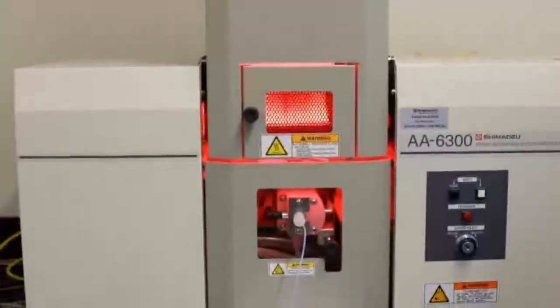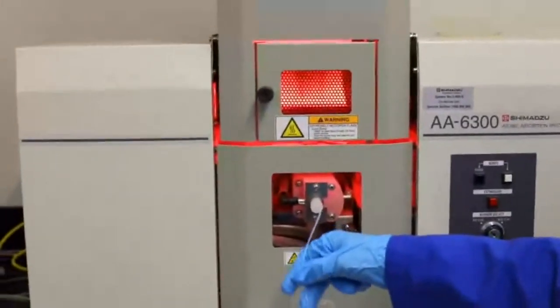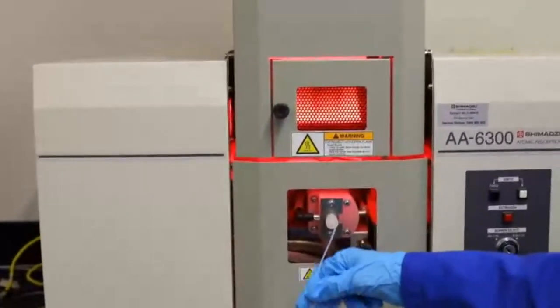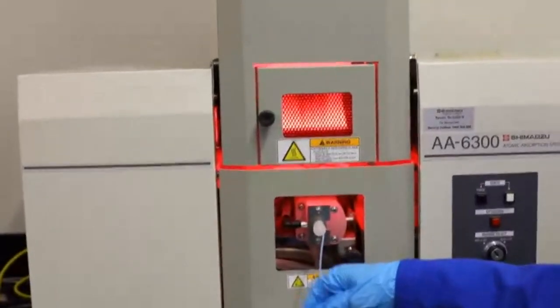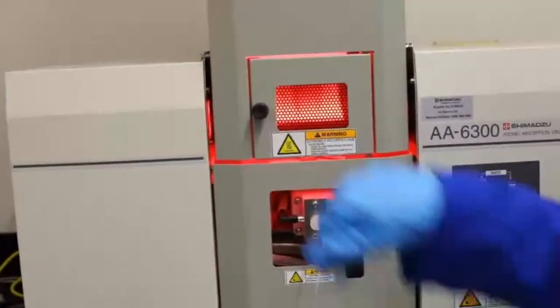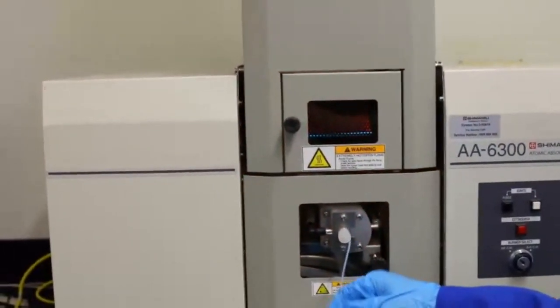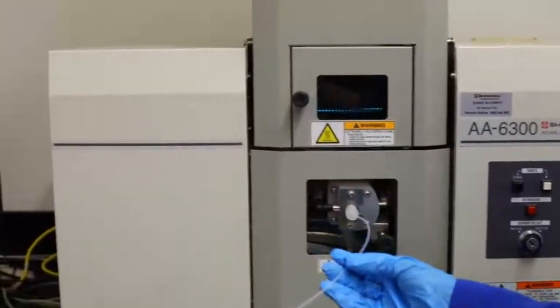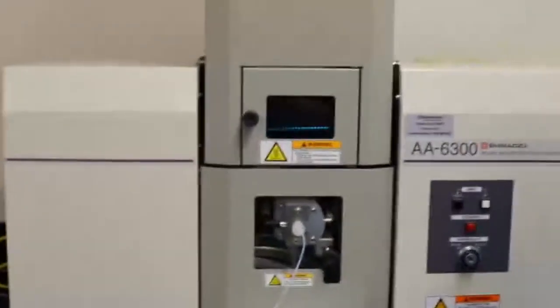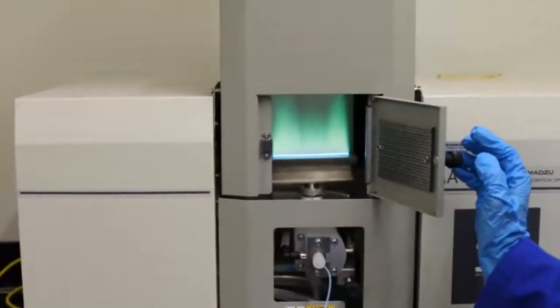So you can see we definitely don't have what our known colour or our unknown was. She's holding to that colour today. Holding it really well. So we just need to wait to make sure that the flame is completely bare of the last remnants. Otherwise, you'll get cross-contamination. E.T., what I might get you to do is to get a new lot of water for me. Thank you. All right, so we're now up to our next one, which is our copper, so our known copper sample. And you can see we've got that beautiful green colour there.